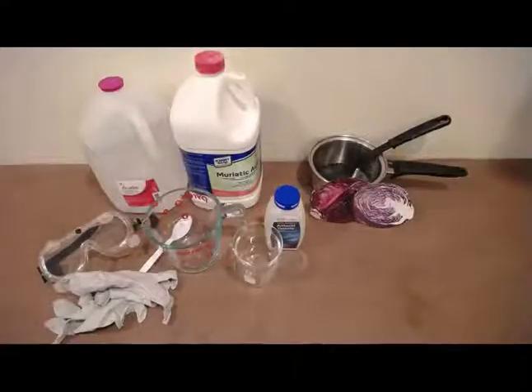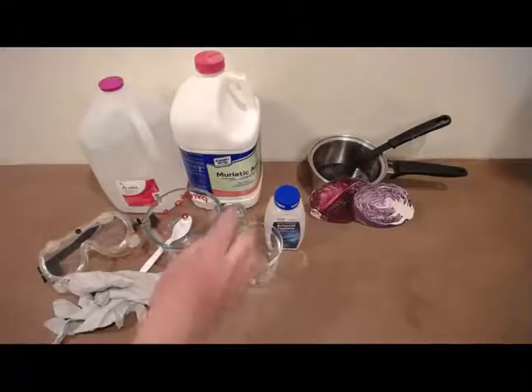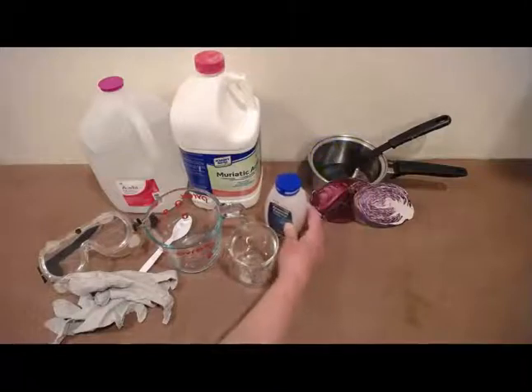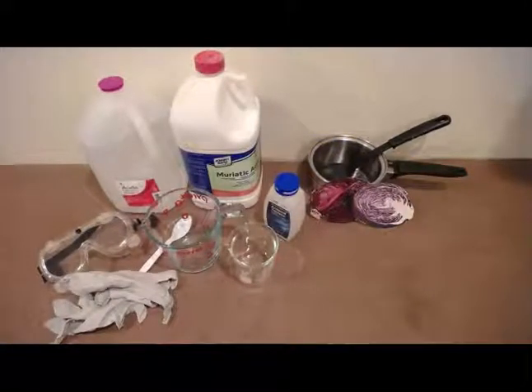The equipment and materials used in this procedure include Tums or some other antacid tablet, toilet bowl cleaner that contains hydrochloric acid, also called hydrogen chloride, as an ingredient, and the best kind is colorless. If you cannot get colorless, get a clear kind that has a light tint of color to it. Do not get the kind that clings to the bowl. So that's really hard to find sometimes.